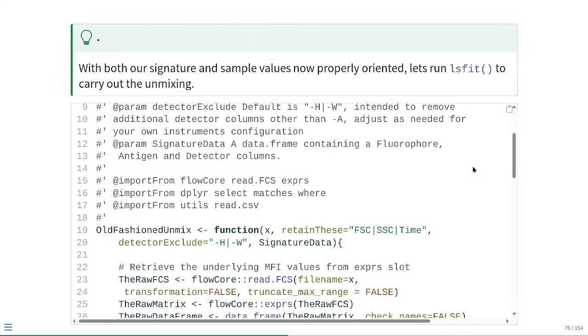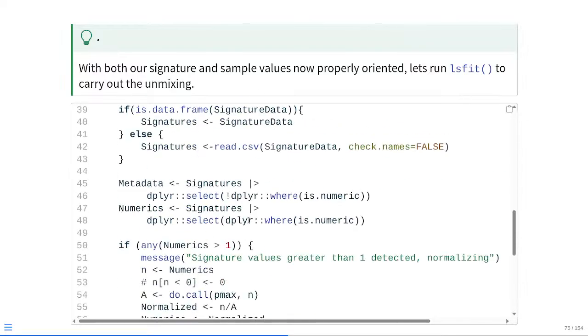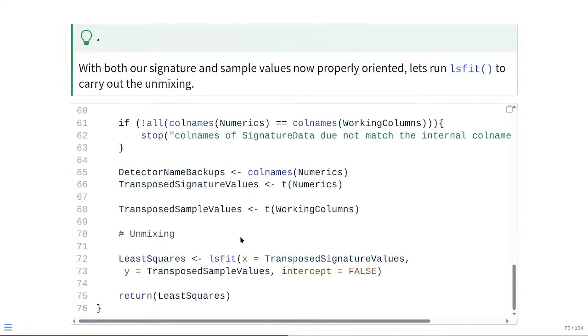So what this is going to look like, as I scroll all the way down, you can see I'm doing a new comment telling us this is where unmixing is actually starting. So in this case, for least squares, we're running lsfit. And after all that build-up, all this code to get here, the actual unmixing itself is rather simple. X is being passed transposed signature values, Y is being passed the transposed sample values, and then we're using an intercept equal FALSE argument. This will run and carry out the unmixing, and it will return to us the list that we need to parse to get the actual unmixing values.